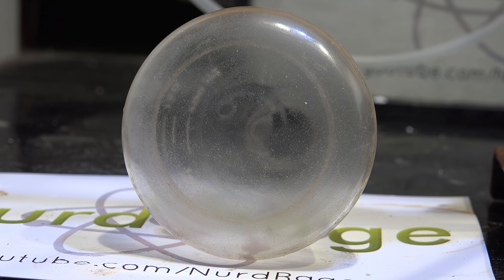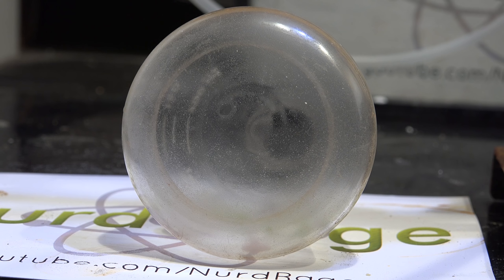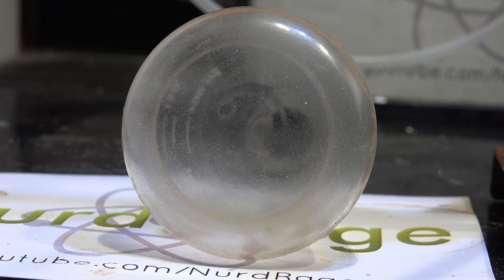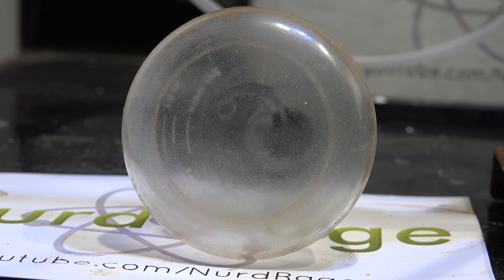Now here is the flask after cleaning. Okay it looks like I blundered by using the same damaged flask as before so I can't tell the difference. If the damage is there it's very subtle. But I suppose that's still an improvement over earlier.